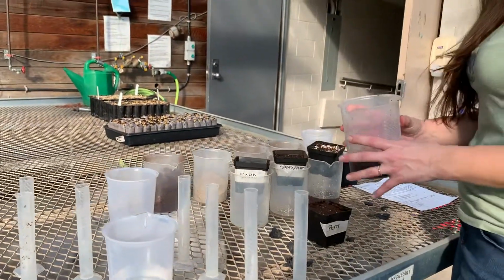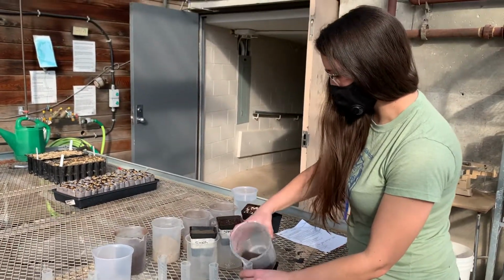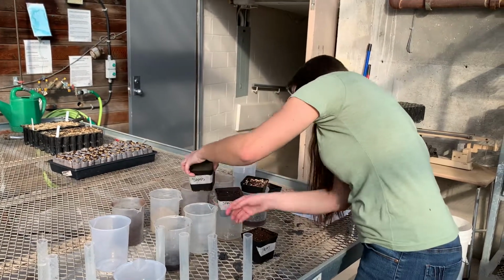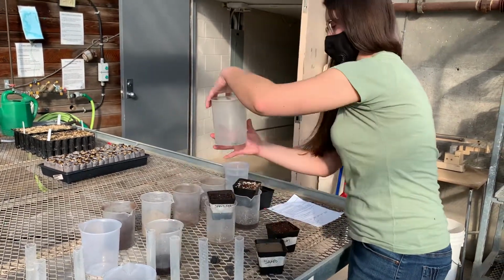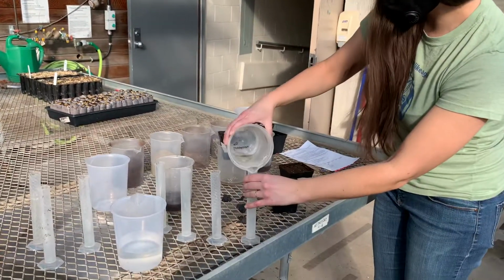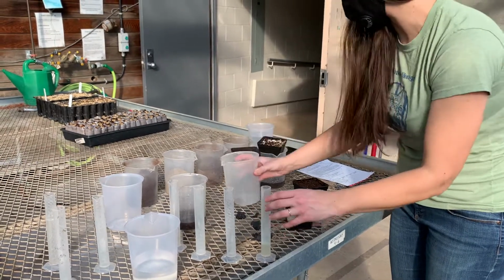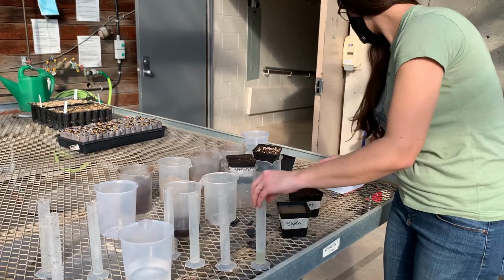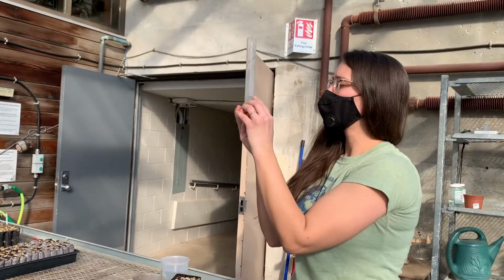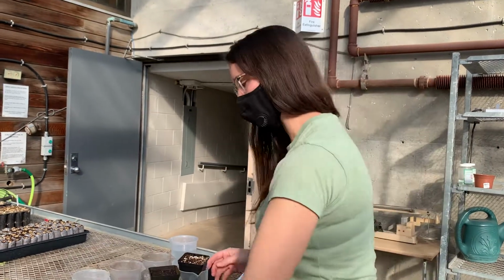So we're starting with peat, which is the second, actually let's start with sand and keep it consistent with how it appears on your lab sheet. So for sand, we can see that not a lot of water came out, but we still want to measure it more accurately in the graduated cylinder. So for our sand, we put 133 milliliters in and 12 came out. So our gravitational water for sand is 12 milliliters.